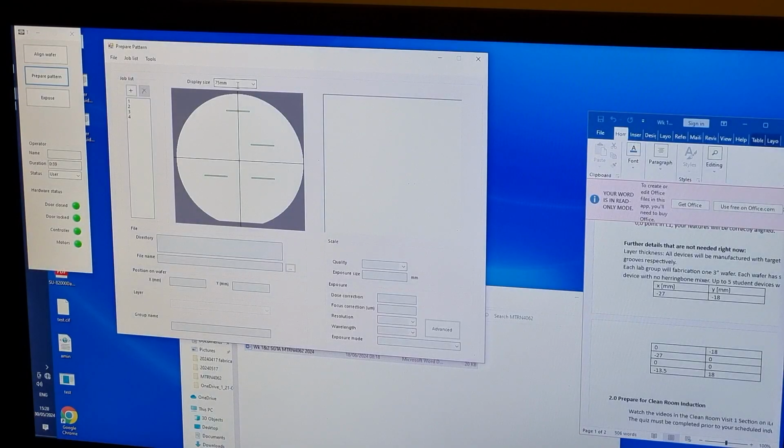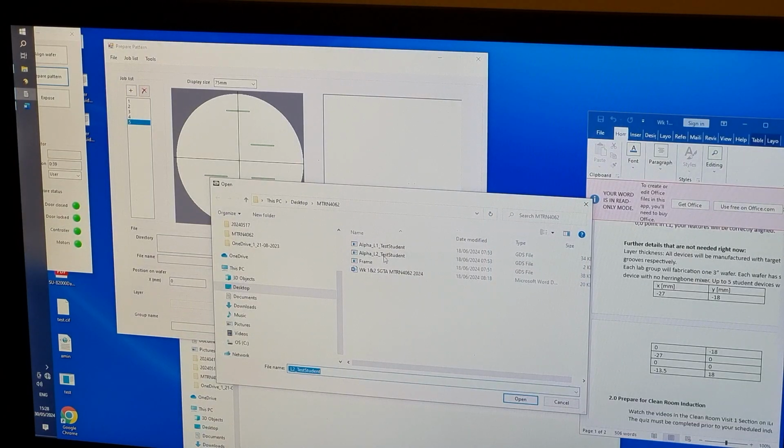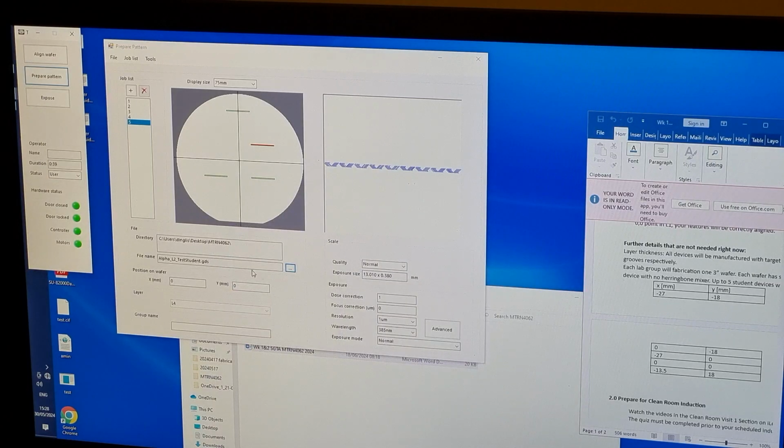We now set up the data to be written into the second layer of photoresist from the Prepare Pattern window. We have already added 4 jobs to the job list. To add another, click the plus button under Job List, then click on the 3 dots to the right of File Name. This opens a browser where you can select your GDS data file. By default, this is placed with its origin at the origin of the wafer. Enter position coordinates in millimeters to move the job to its correct location on the wafer.